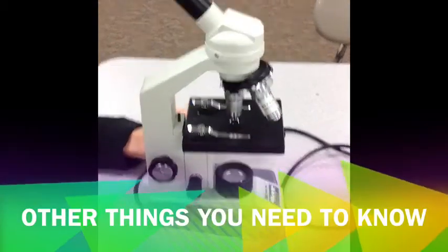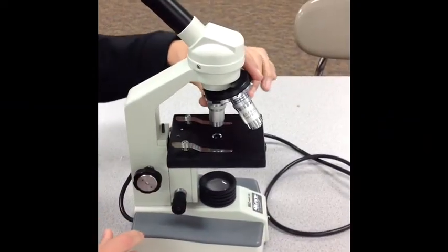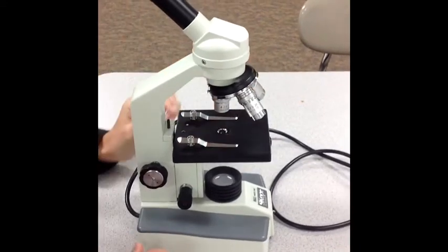Before starting, always make sure that the stage is all the way down and that the objective lenses are at the lowest setting. The nose piece always helps with that.